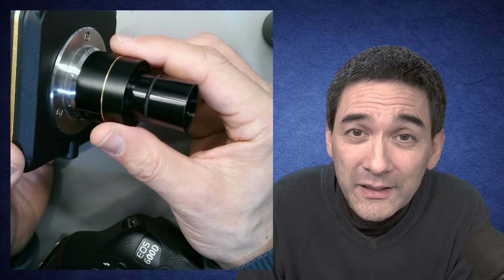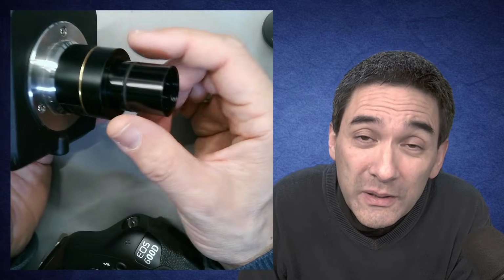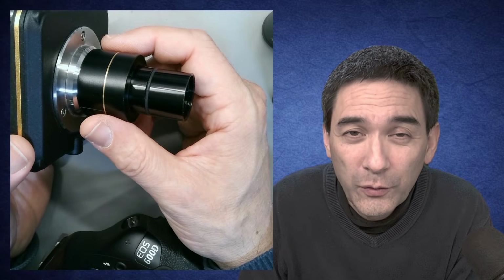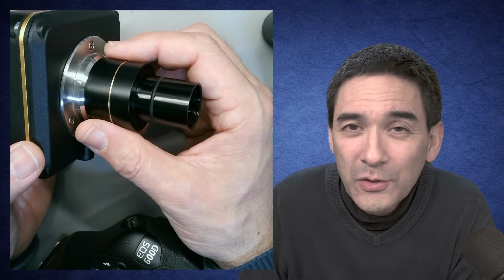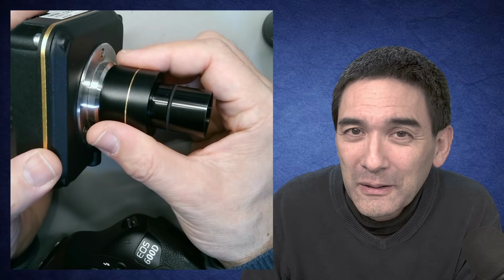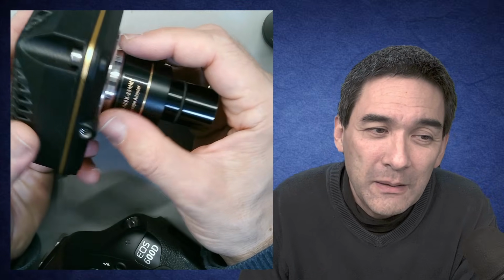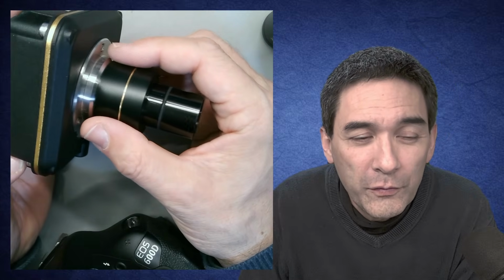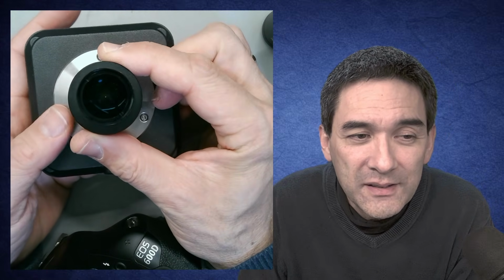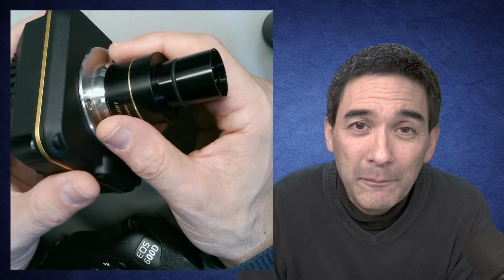This is parfocality, and this is also something that those intermediate optics have to fulfill. So you see, these little optical devices serve multiple purposes. But I hope I was able to give you a little bit of an overview of why they exist and what they're supposed to do.